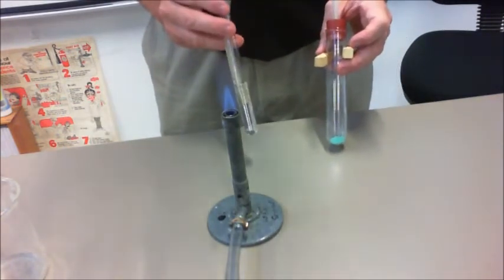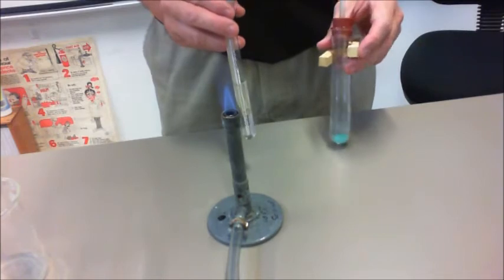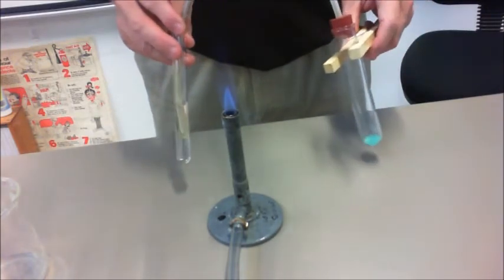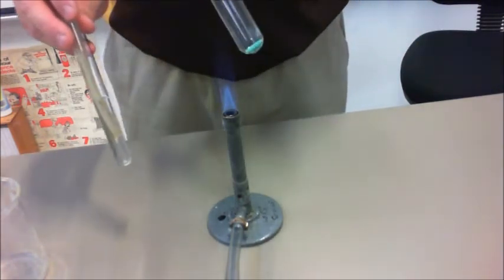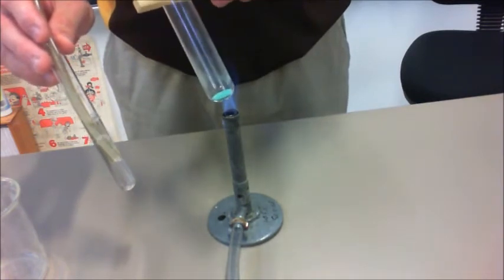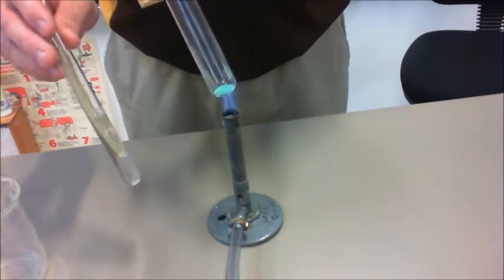Inside the lime water test tube, we place the delivery tube, and then we place our copper carbonate on top.